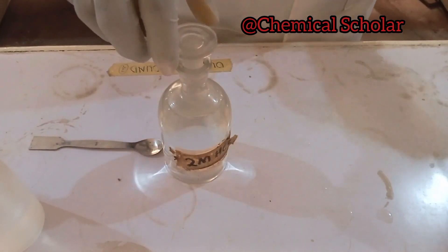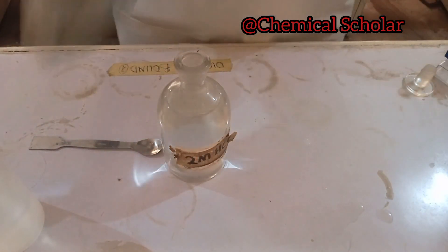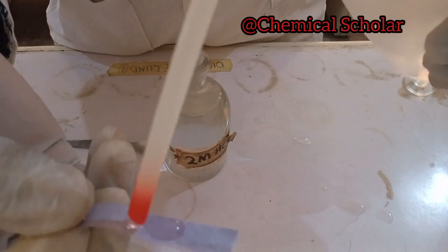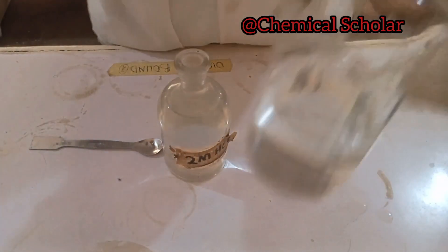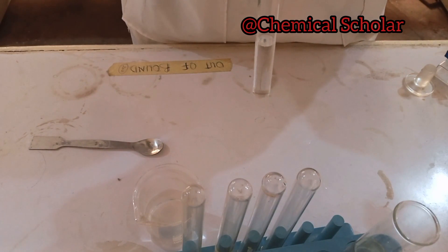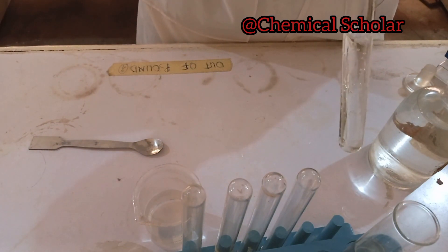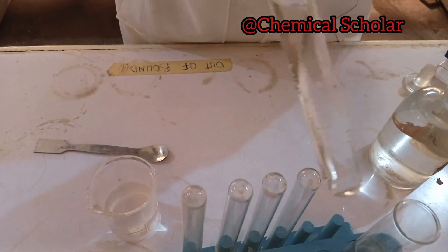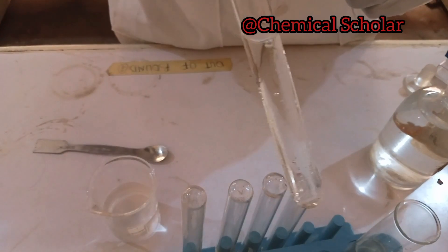When we pour the HCl, we are expecting there will be an effervescence of a colorless, odorless gas. We wet the litmus paper so it is damp and can react faster. We also have lime water ready to pass the gas through to confirm if it is CO₂. Now we pour the HCl — you can see the effervescence as the gas comes out. You can see how the gas has changed the litmus paper.